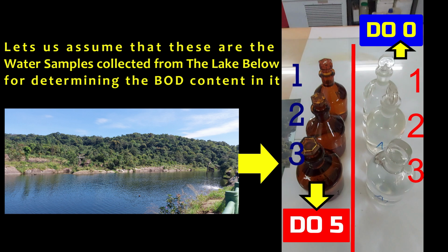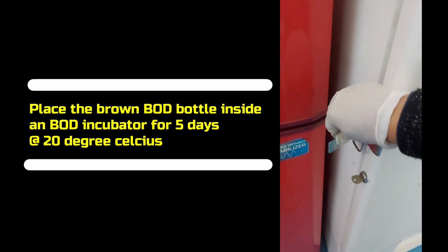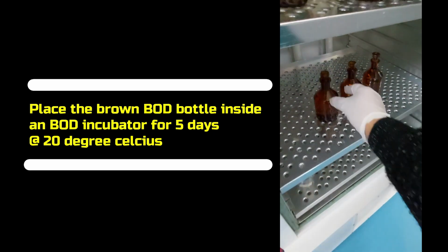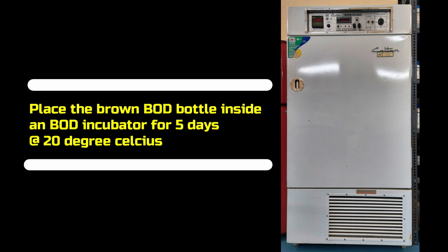Now let's assume that the samples from the field have been transported to the lab. So first of all, when you reach the lab, take these brown BOD bottles filled with water samples to be analyzed and place them inside a BOD incubator for 5 days at 20 degrees Celsius.